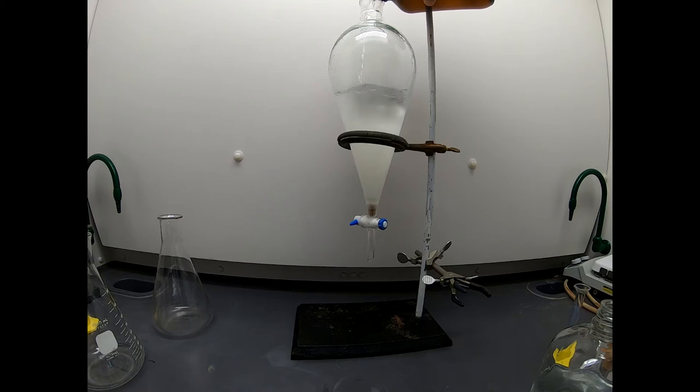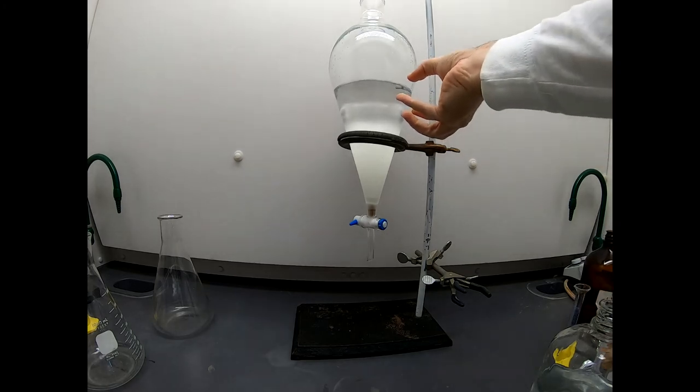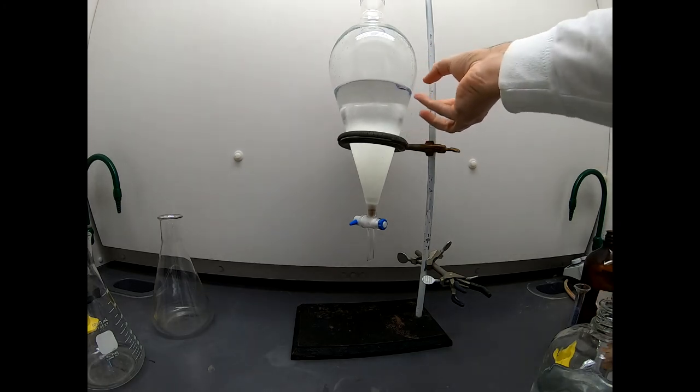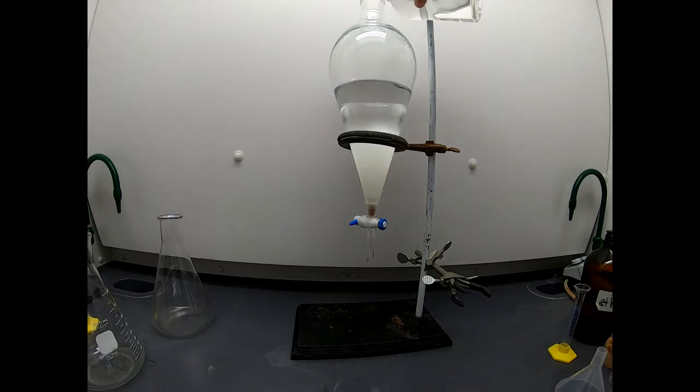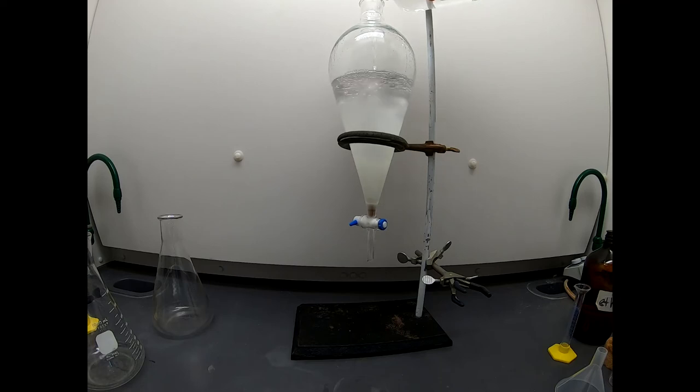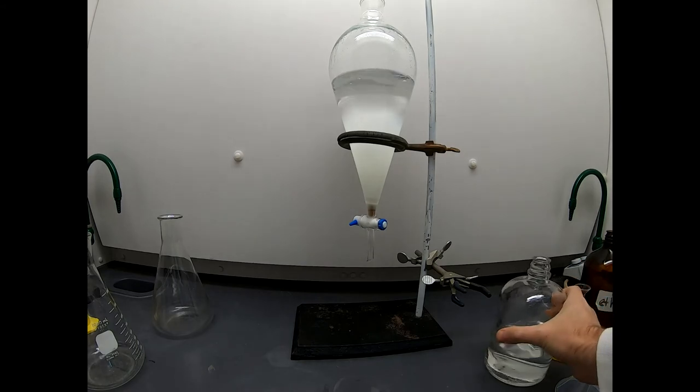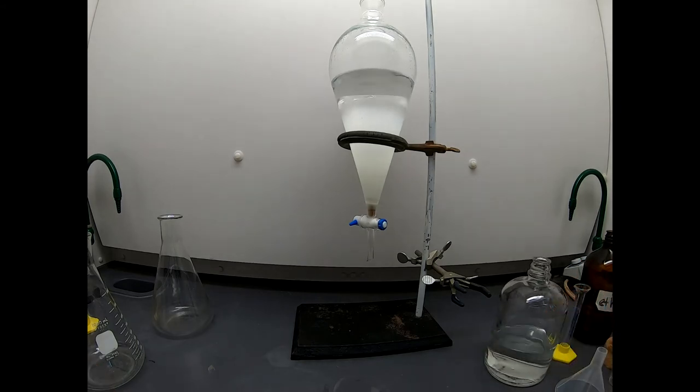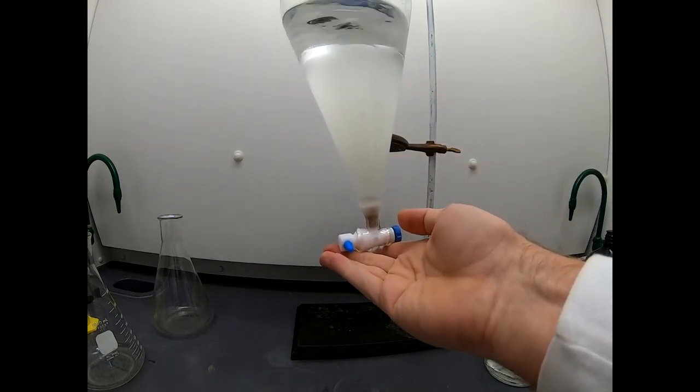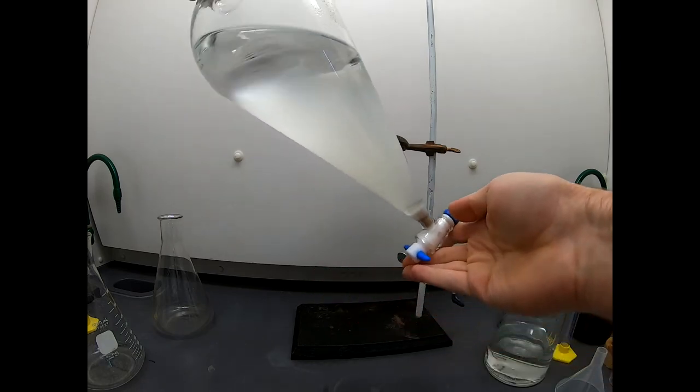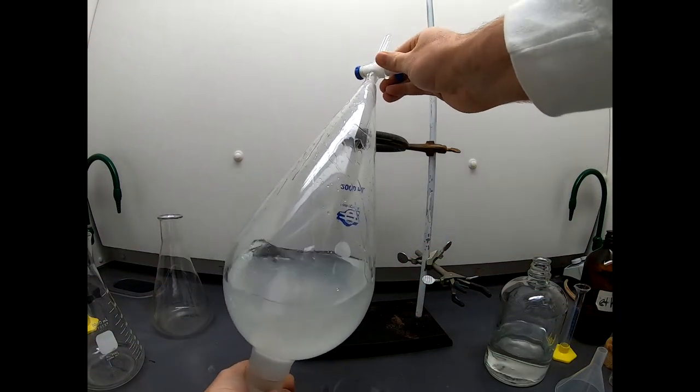Now let's go ahead and just add solvents in here directly. This is all ether. Nice non-polar solvent. And we're going to add quite a bit. We need to add quite a bit because we want our layers to be distinct. We want this layer, even though it contains our product, to be mostly ether. And the bottom layer, even though it contains some DMF, we want it to be mostly water. We want to make everything make a choice. So we'll throw a lot of water in here, and of course we've got a lot of ether. Now let's just see how well this works. I'm going to put the top into this sep funnel. This is a lot of weight, so this is definitely a two-hand job.